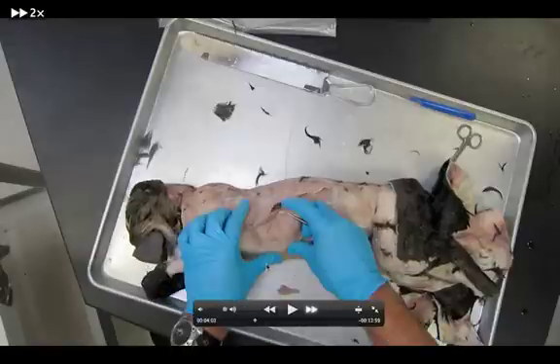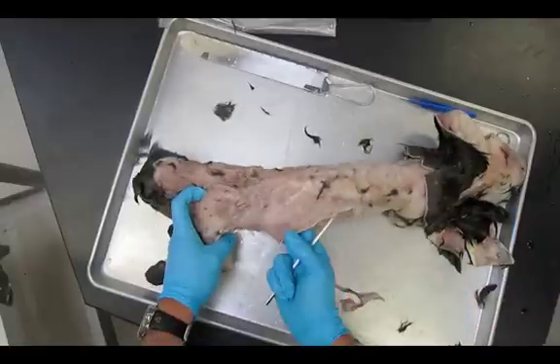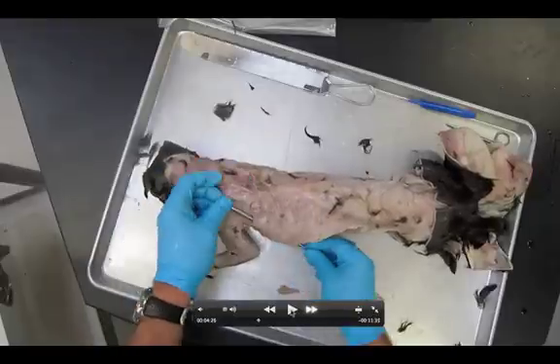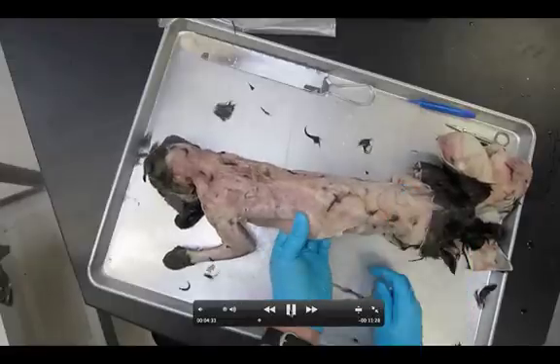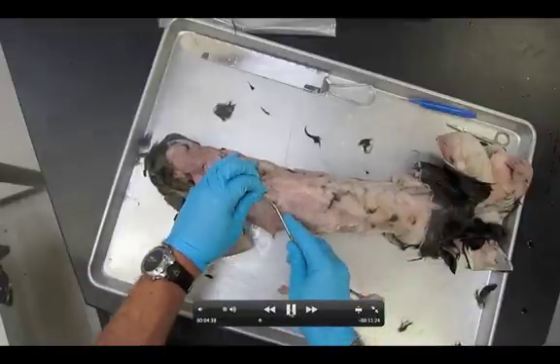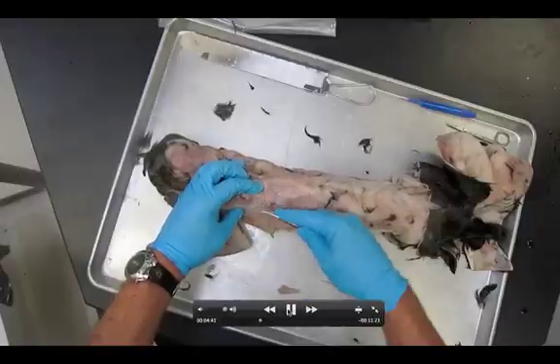There's a little muscle running right there that I just pointed at. Now I've kind of exposed the latissimus dorsi — I can see how much I've removed. At that moment you might have seen me getting my probe all the way under. Now we're going to locate the spinotrapezius. You might be able to just barely notice the line. I'll try to highlight it — you can see this little line right there, going back in that direction. That's what I'm going to attack now with my probe.